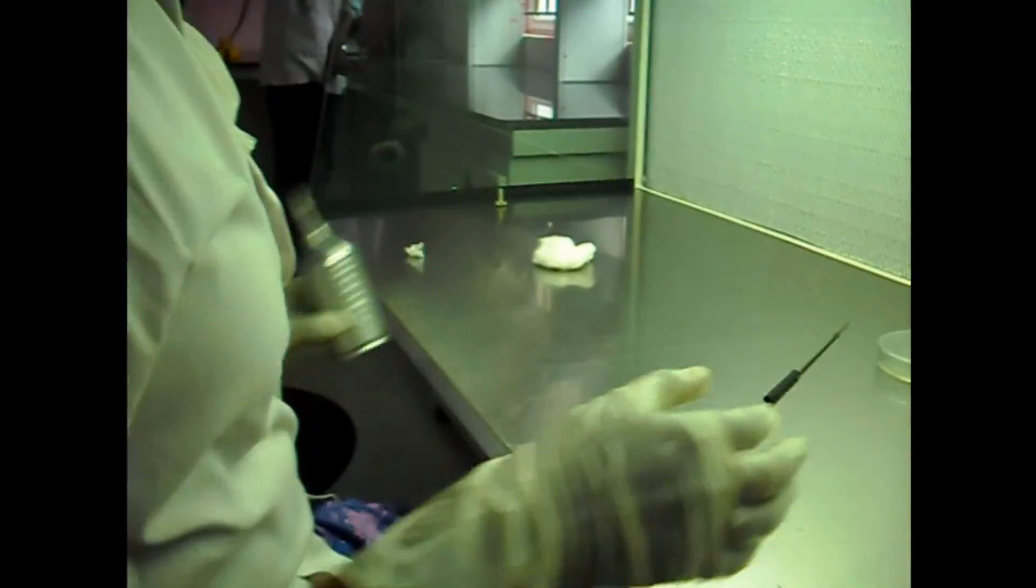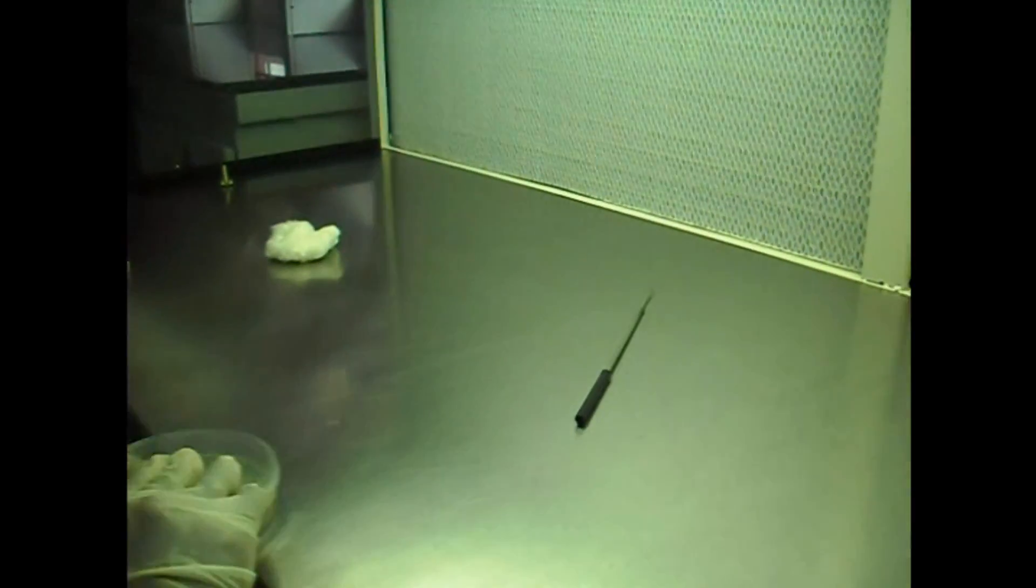Blow off the spirit lamp. Remove the materials from the laminar airflow chamber. Wipe the laminar airflow chamber again with 70% ethanol.